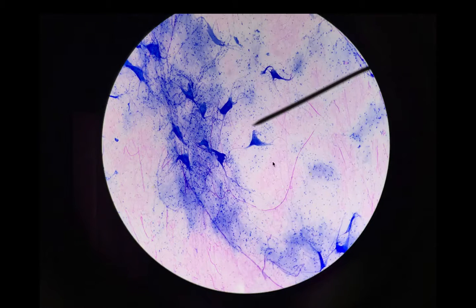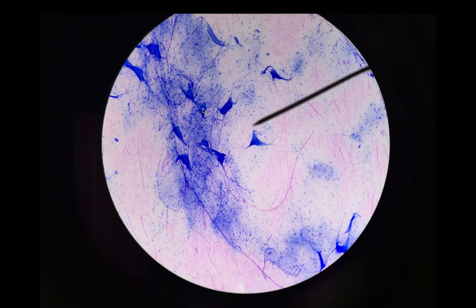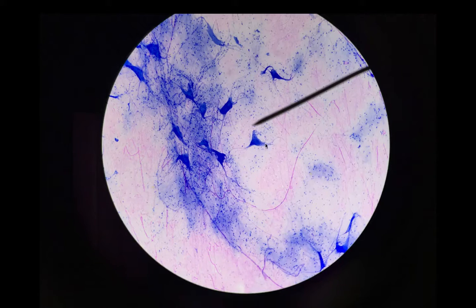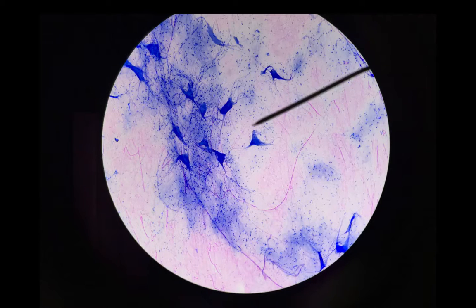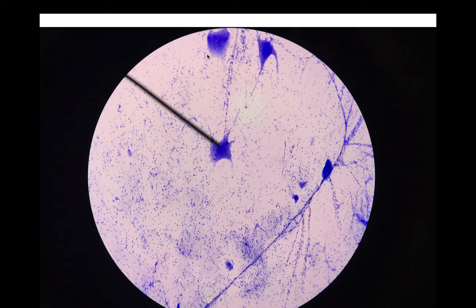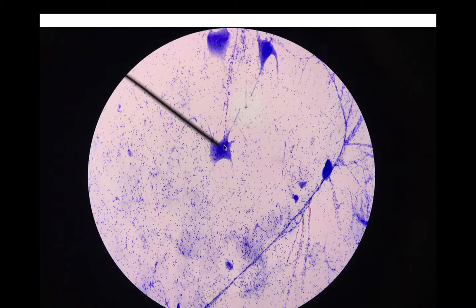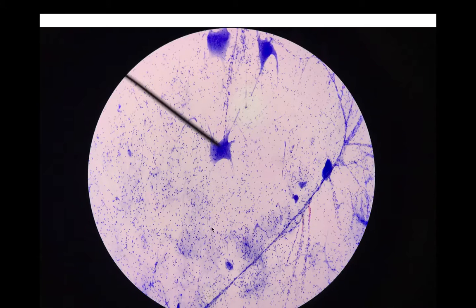This was taken from one of our slides in class. Again, you see these big structures here; it's hard to see the nucleus at this magnification, but these are definitely multipolar neurons. Again, the dark little dots in the background are the glia cells. Be sure you review the glia cells of the CNS versus the glia cells of the PNS. Here again, taken from one of our classroom slides, you can see the lighter-stained nucleus and then the dark nucleolus right in the center. These neurons have more than two processes, so they are multipolar neurons.